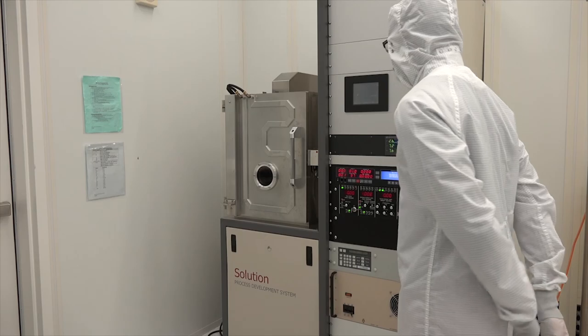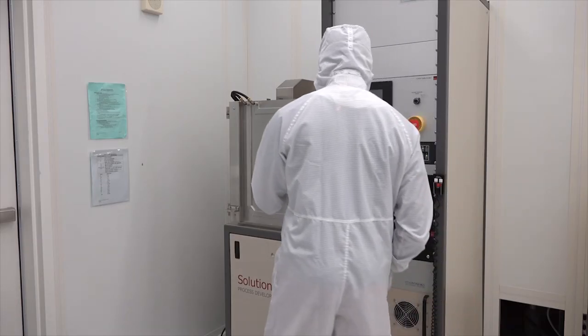After a couple of minutes, the chamber pressure equals the room pressure. Now we can open the door.